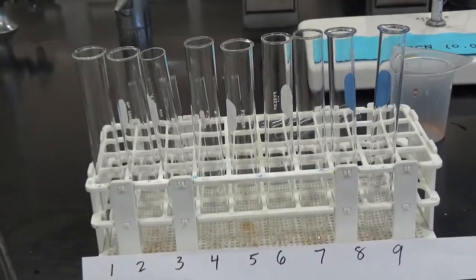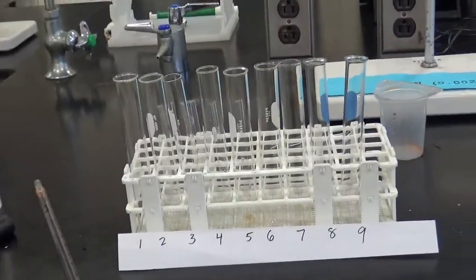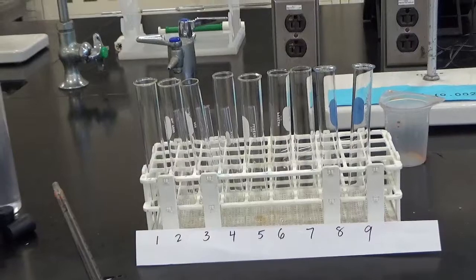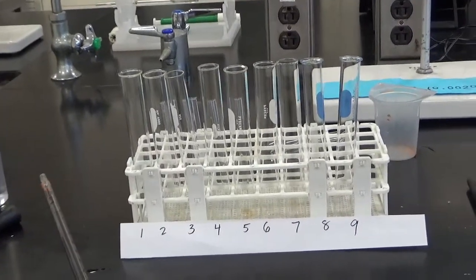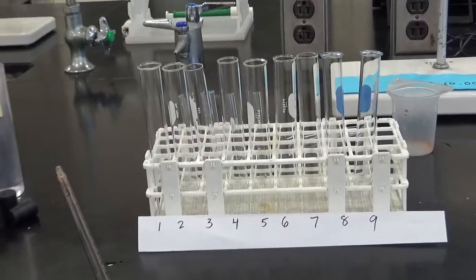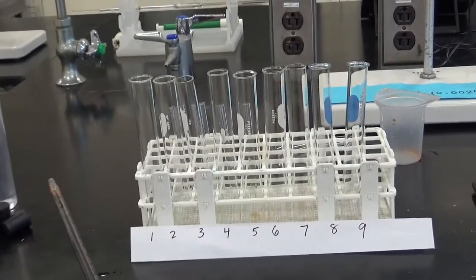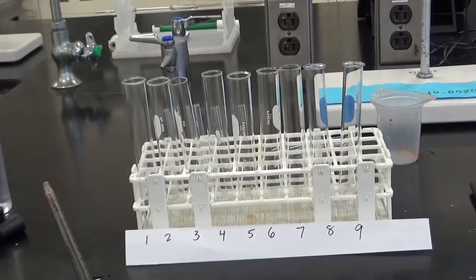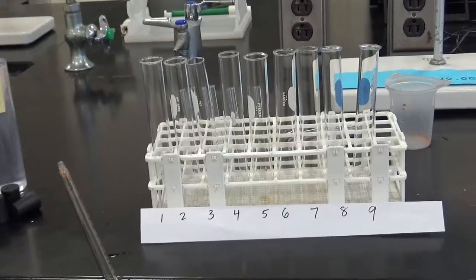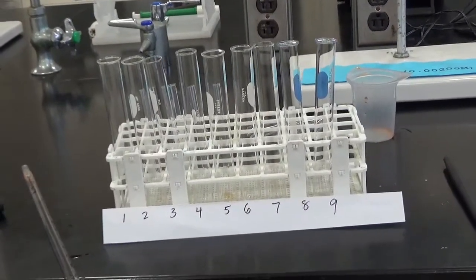And then what we're going to do is measure the absorbance of each one of these samples and figure out from the absorbance, because the absorbance is proportional to the amount of complex, right? Because it's the complex that's colored, and that's the thing we're going to measure the absorbance of. So we'll see what happens to the concentration of complex for all these different mixtures, and it will allow us to figure out what the stoichiometry of this reaction is.